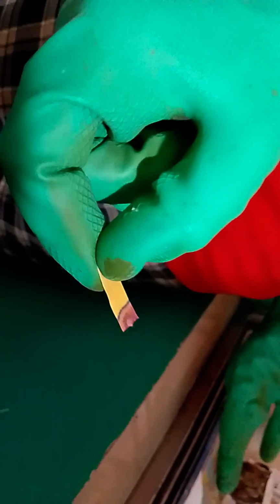Because it promises to bleach the paper. We need to wait for a moment. I think it ran out of the bleach. I need to fill it up a little more with this. Yeah, now that's turning white.